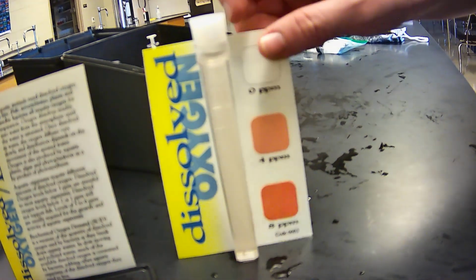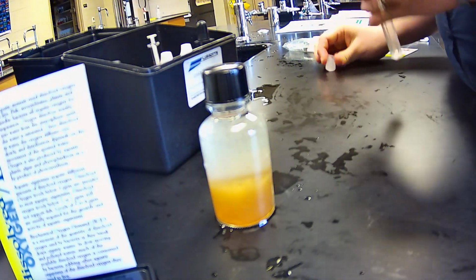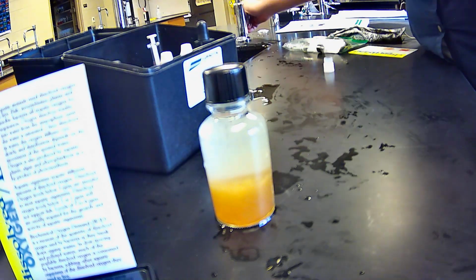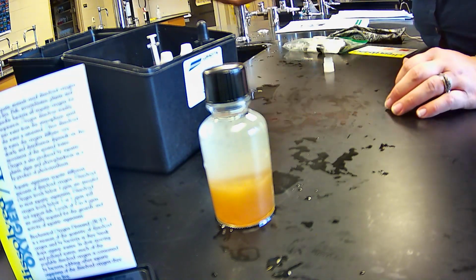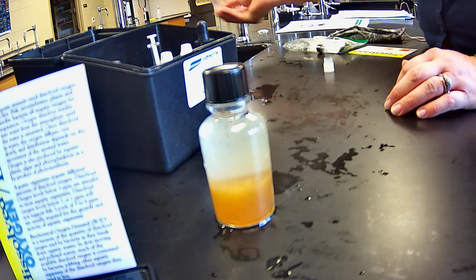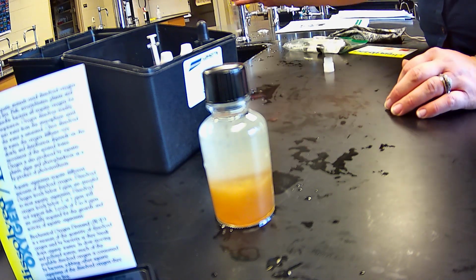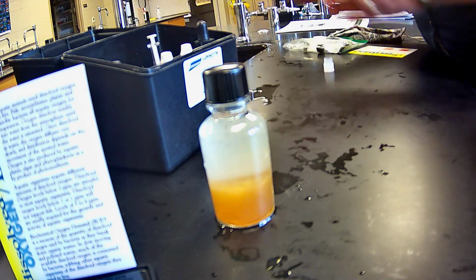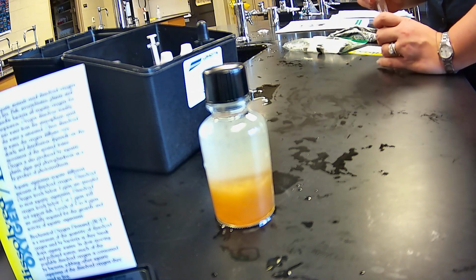All right. So hopefully you got that data. I think just another second. Again, going to run a lot of water. If we were in the field, we would just put that over with the vegetation, not straight in the water, so the plants can absorb any chemicals that could be there. Let nature take care of itself. Okay.